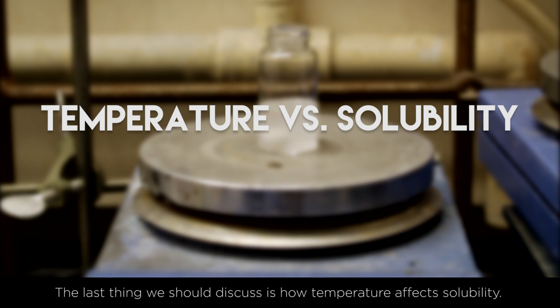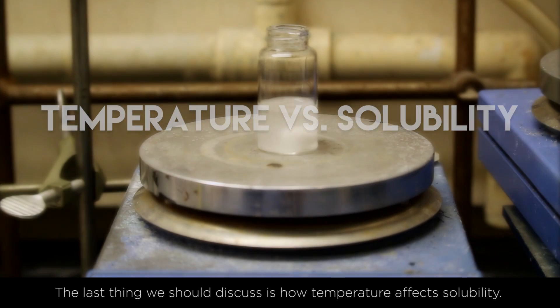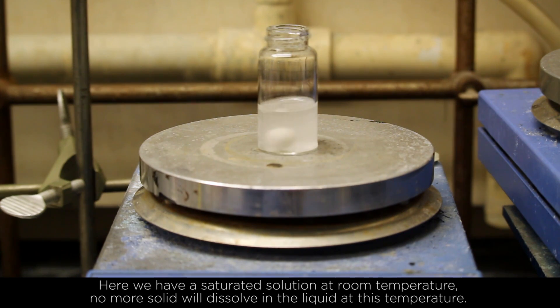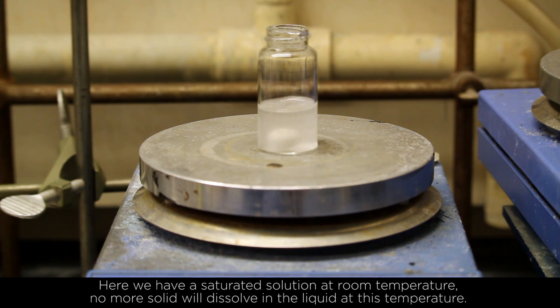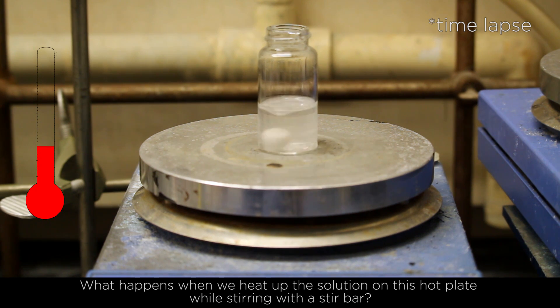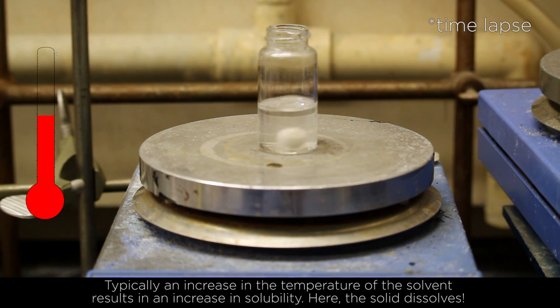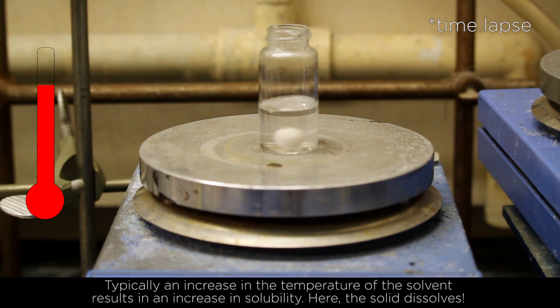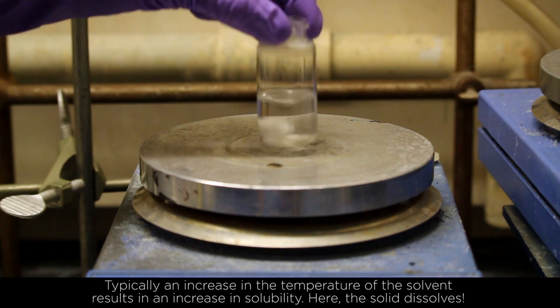The last thing we should discuss is how temperature affects solubility. Here we have a saturated solution at room temperature — no more solid will dissolve in the liquid at this temperature. When we heat up the solution on this hot plate while stirring with a stir bar, typically an increase in temperature of the solvent results in an increase in solubility. Here, the solid dissolves.